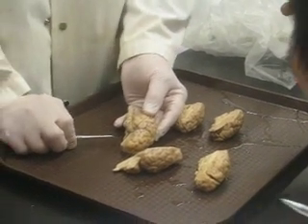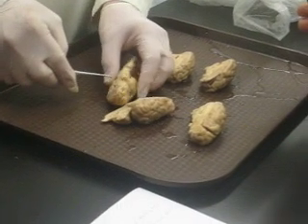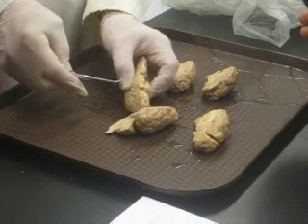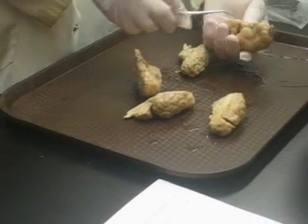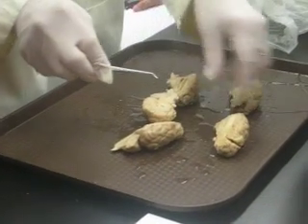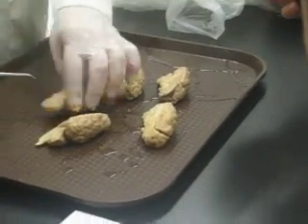Okay. Now, optic nerve. Optic nerve is this big fat one here. There's the optic nerve. I mean, we've got the brain cut in half, so you only have one optic nerve. But that one is the optic nerve. That big one there. No matter which one you find, you can find an optic nerve pretty easily on any of the ones, no matter what kind of shape it's in.